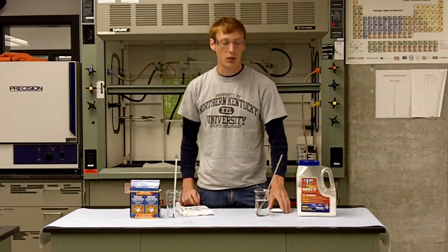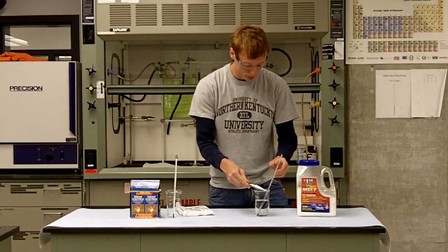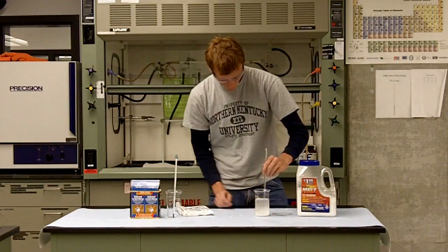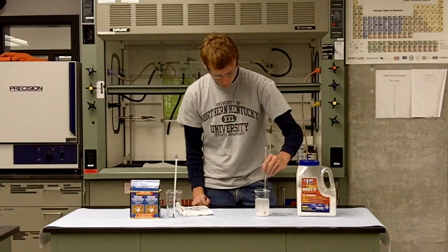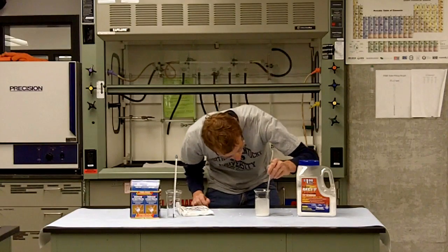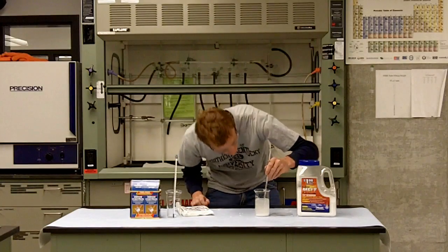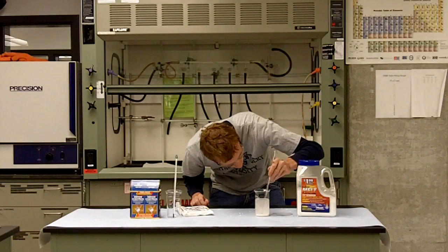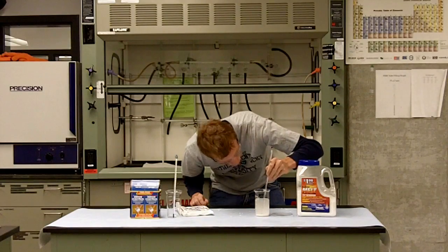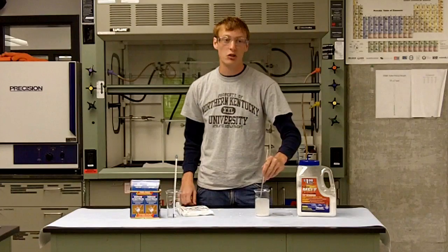Now let's see what happens when we put the calcium chloride in the beaker. The temperature is rising because it's an exothermic reaction — we have 31, 33, 34 degrees Celsius. As you can see, the temperature is rising because this reaction is releasing energy.